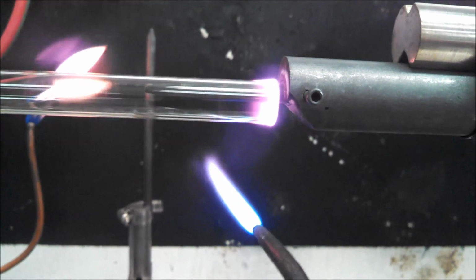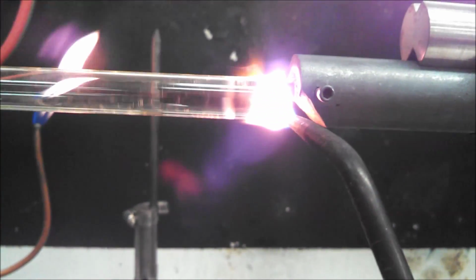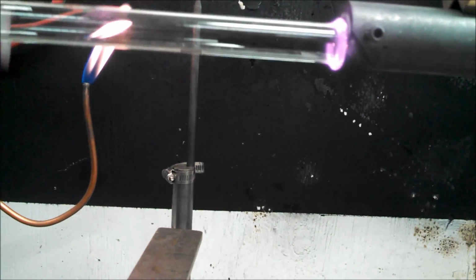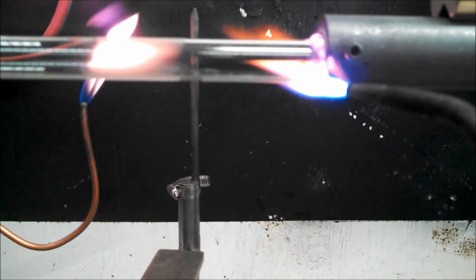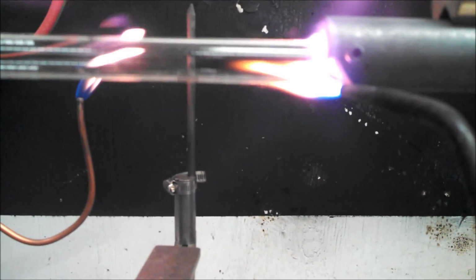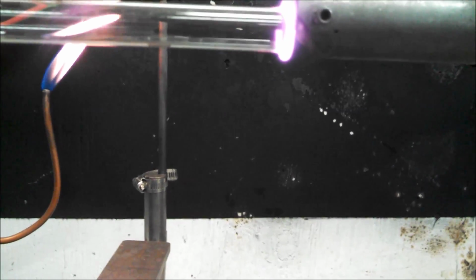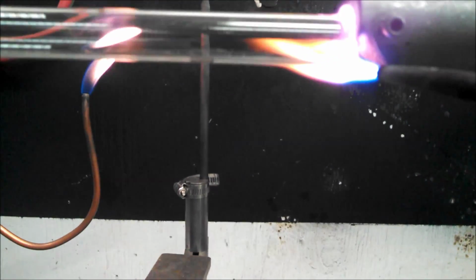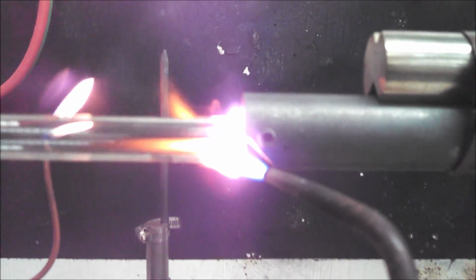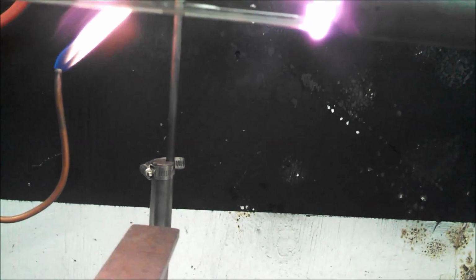That starts coming back. Right about there. Kind of hard to do. So I leave the flame on this side because I don't want to mess up the tubing on the left side. I've done some of these, I know how much glass I need to make the flange, so I'll keep on going back with it. That should be it right there.